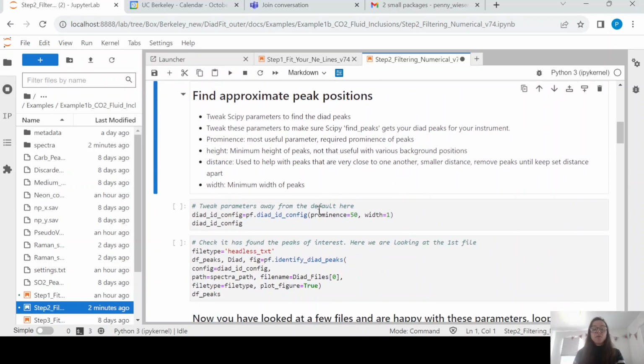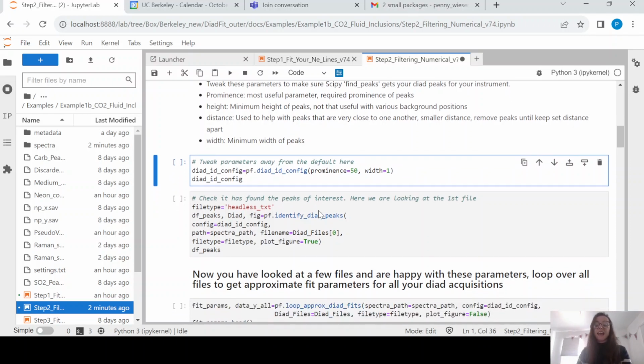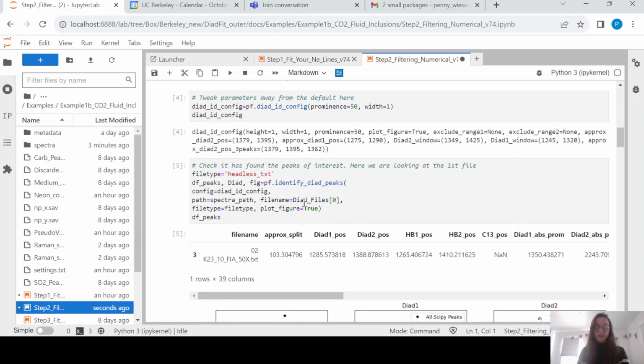Okay, so what we then do is we are going to tweak a function which helps us find the approximate position of the diad peaks. This isn't fitting Voigt peaks to them, this is literally just using SciPy find peaks on the raw Spectra to say where approximately are the peaks. So the key parameters are, as normal, your SciPy find peaks parameters, so specifically the prominence and the width of the peaks. Okay, so we're going to run that, and then we are going to look at the first file, so just to see how this is doing.